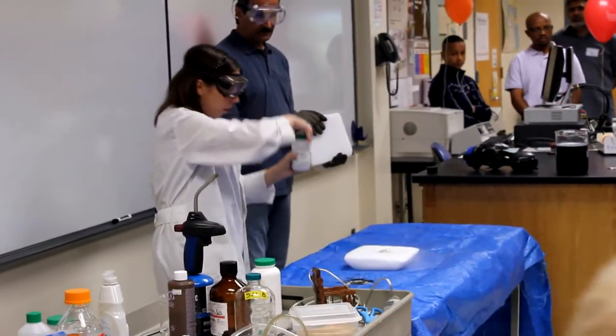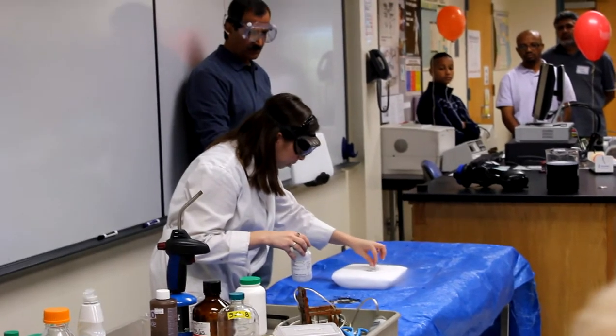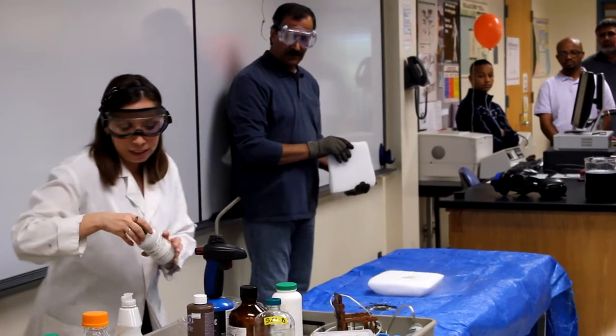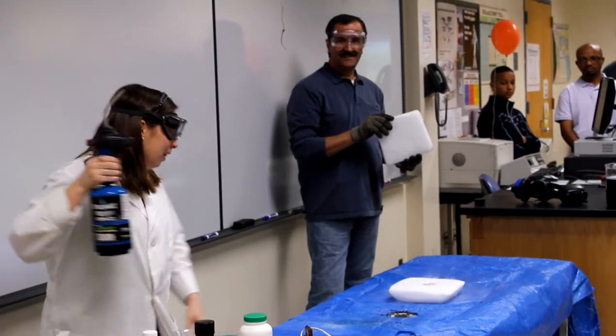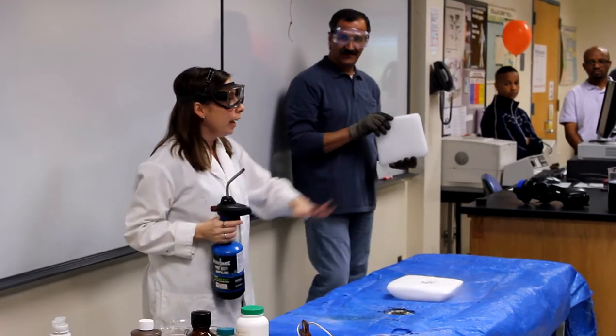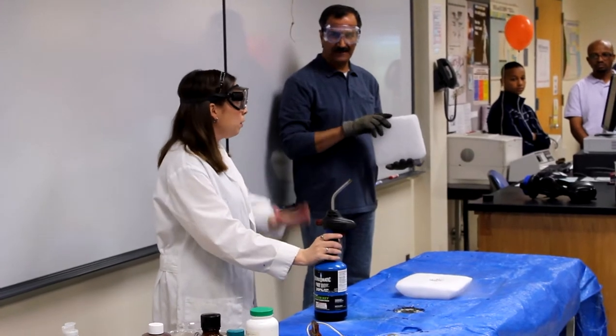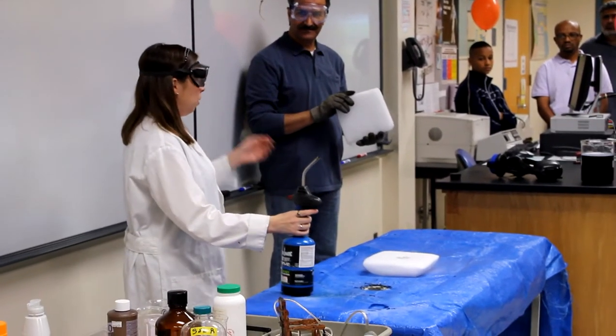And so what I'm going to do is I'm going to put it in my dry ice. I'm going to set it on fire. And then we're going to cover the fire with the dry ice. So if I cover the fire, do you think my fire should go out?